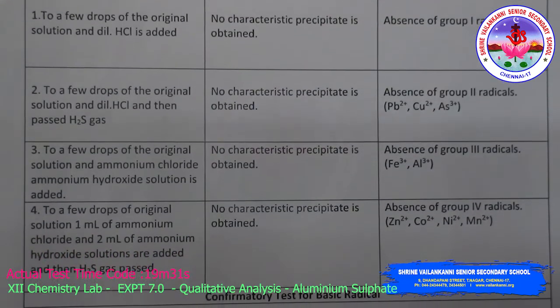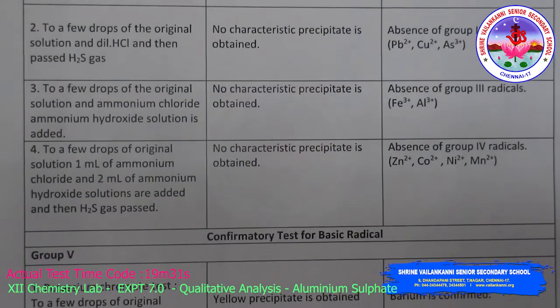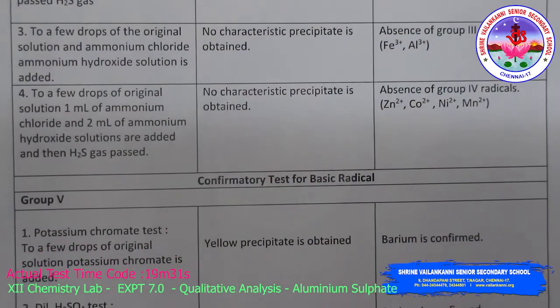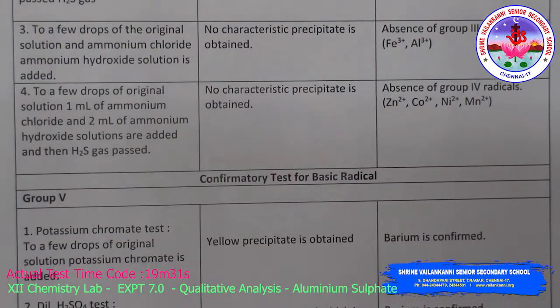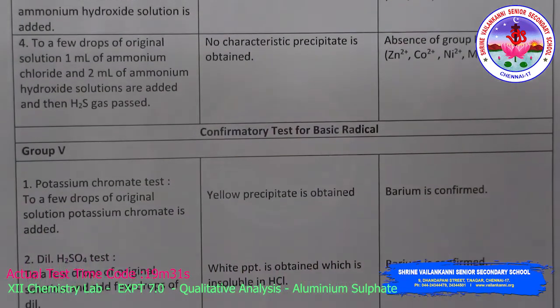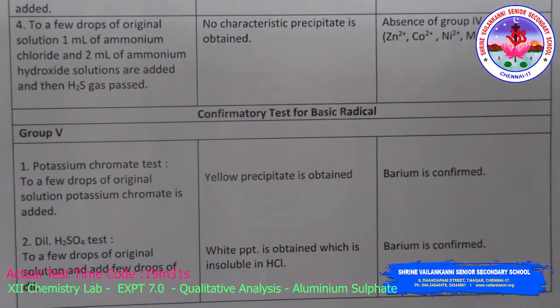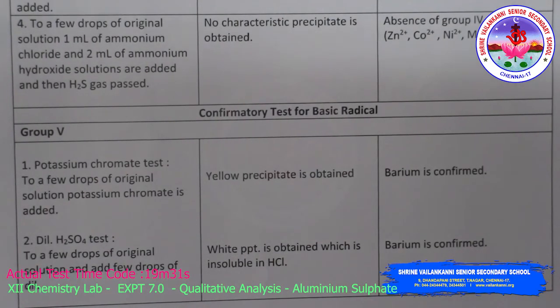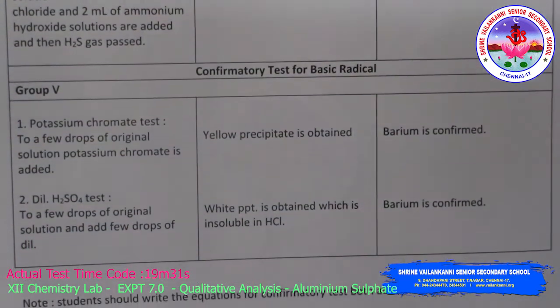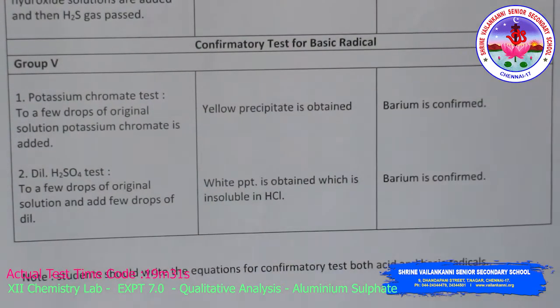Then to a few drops of original solution, add ammonium chloride and ammonium hydroxide solution. No characteristic precipitate, so absence of group 3 radicals. Then to a few drops of original solution, 1 ml of ammonium chloride and ammonium hydroxide solution is added and H2S gas is passed. No characteristic precipitate, so absence of zinc, cobalt, nickel and manganese, that is, absence of group 4 radicals. Then the confirmation test for the basic radical.